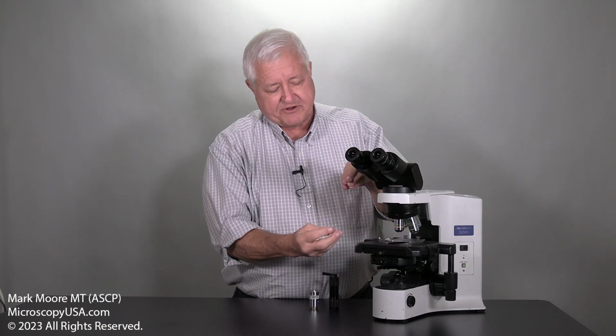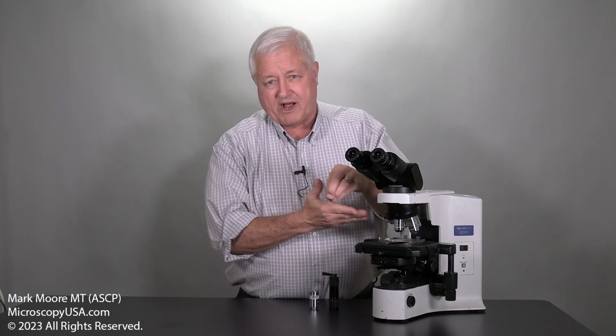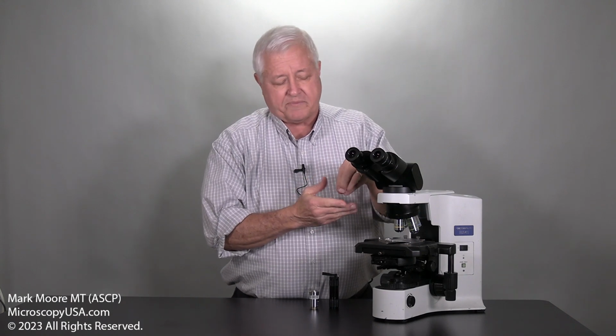One other little caveat: in the pathology department, histopathology, the slide media that they use to make the slides will sometimes get onto the tip of the objective. And that's not good because it dries on there and you still get an image, but it's just not very sharp. That has to be cleaned with a special solvent. So that's another possible cause. But these are just little tricks to find out if you really do need to go spend that big money on buying a new objective or not.